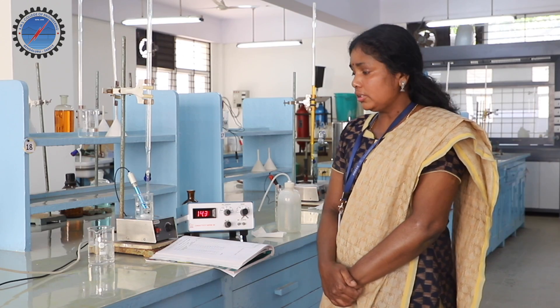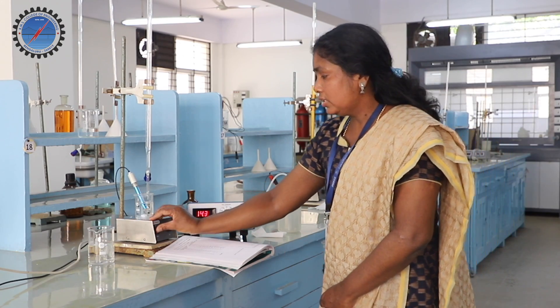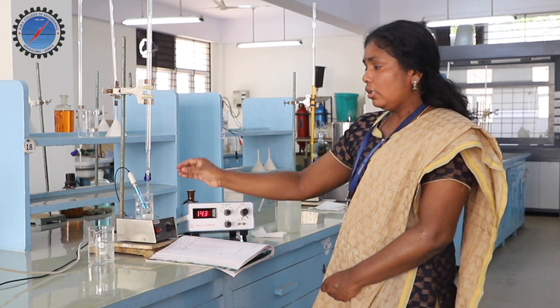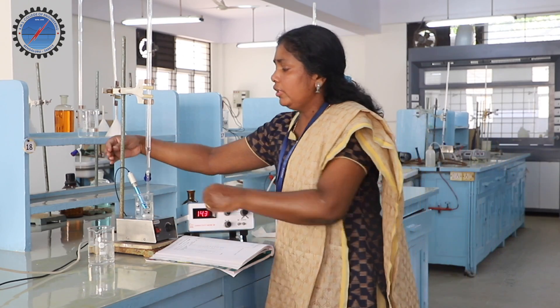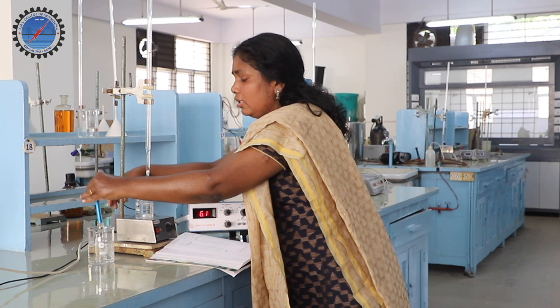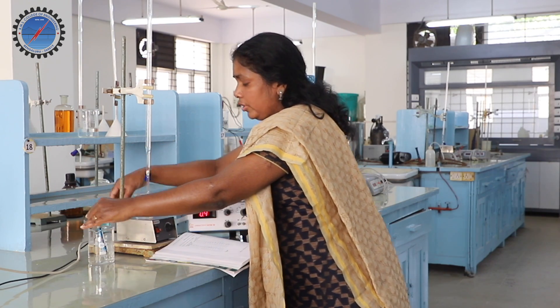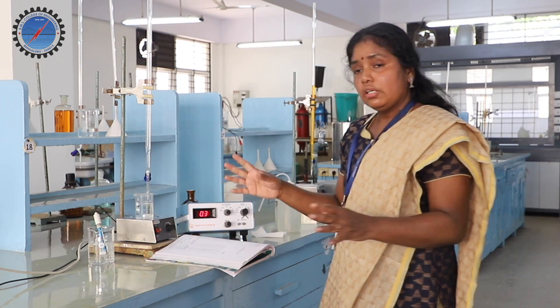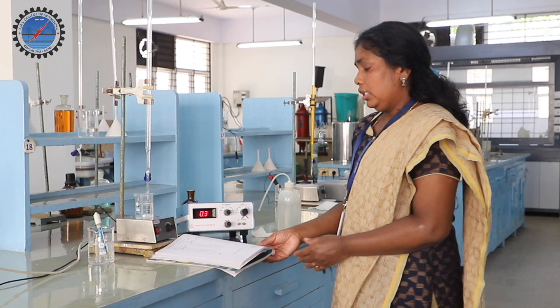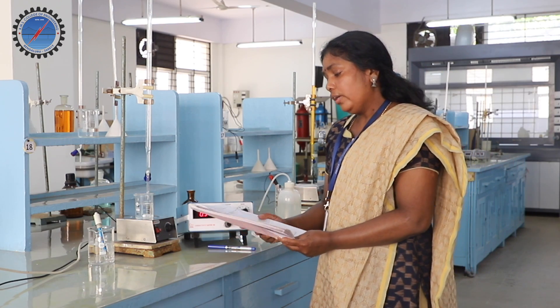Take out the conductivity cell from the acid mixture and place it in a beaker containing distilled water. You have now completed the measurement phase of the experiment.